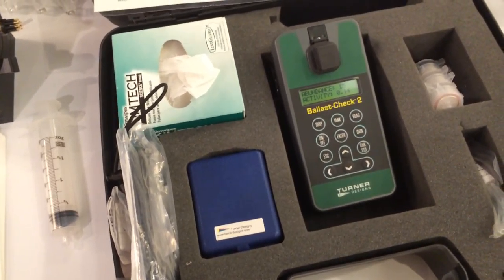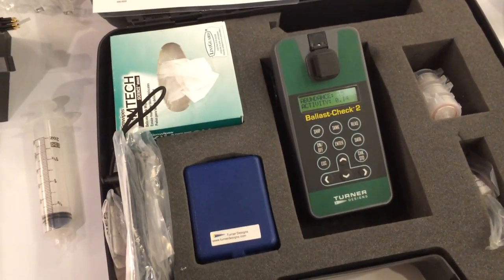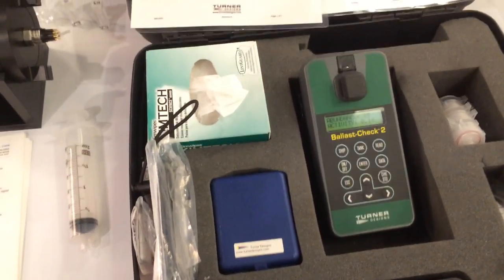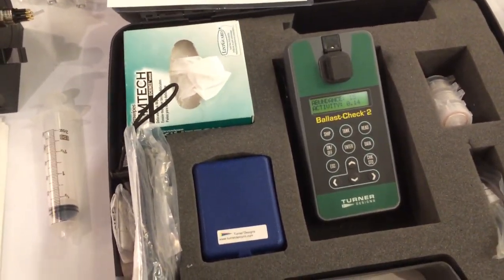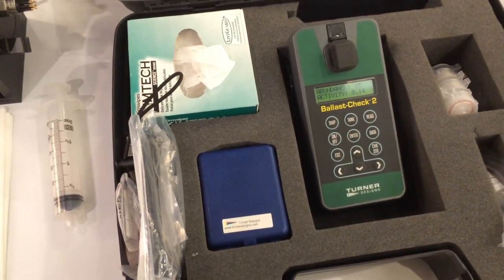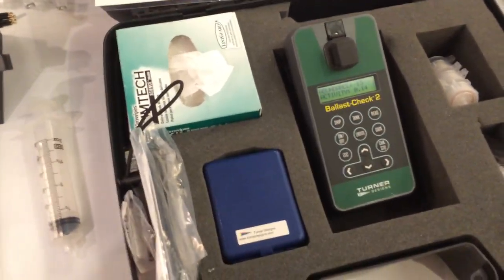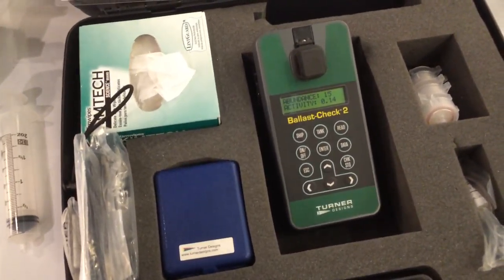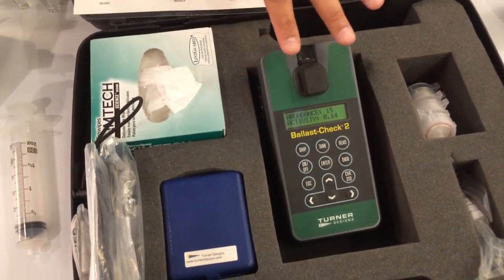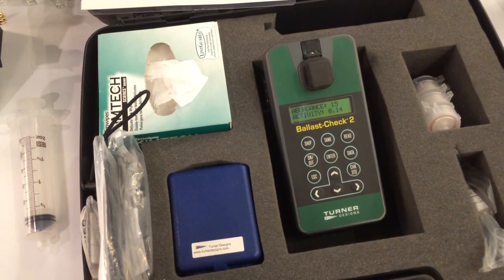How long have you guys been making these? Well, the ballast water discharge standards were just recently ratified by all the different participating countries. This unit itself has been out for about a year. Are your customers mostly U.S. or international? Right now mostly outside the U.S. because the U.S. is still in a little battle between the different departments. So as soon as they get their stuff underway, I think they'll be adopting a tool like this for determining cell abundance.